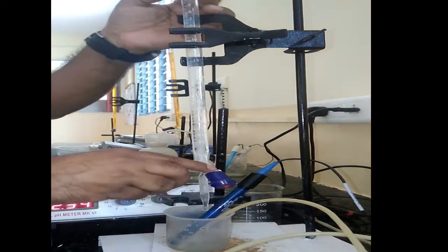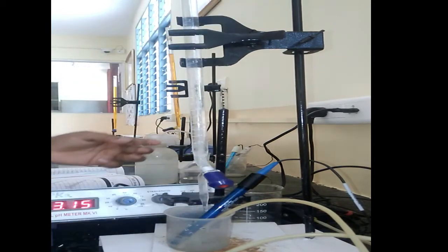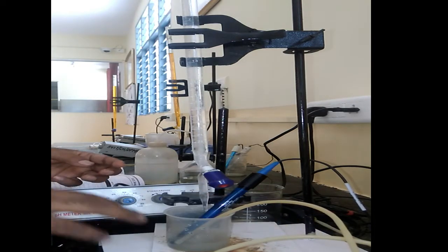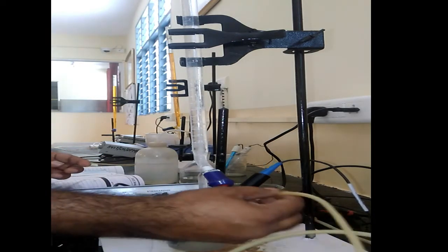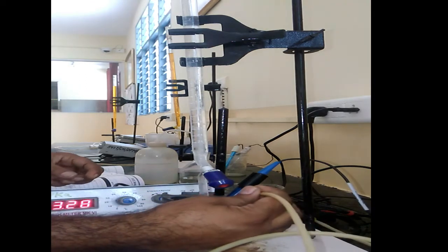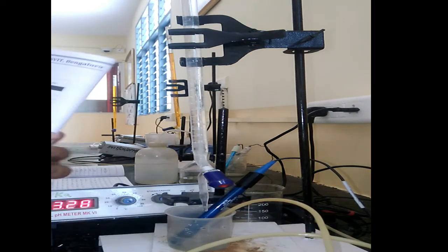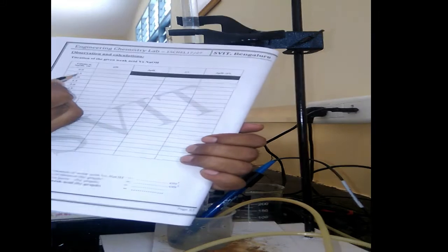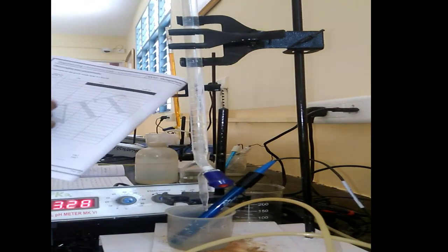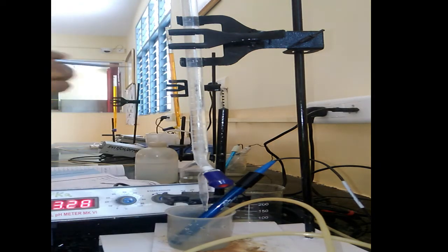Now I am adding the NaOH in the increment of 0.5, only 0.5 I added. So we should not take the reading immediately, let us wait for a few seconds so that the reaction mixture mixes well. After 15 seconds I have to note down the rise in the pH value. So it rises to 3.28. Now let us note down the 3.28 value at 0.5 ml. Like this continuously we have to record the changes in the pH value after the addition of each 0.5 ml.